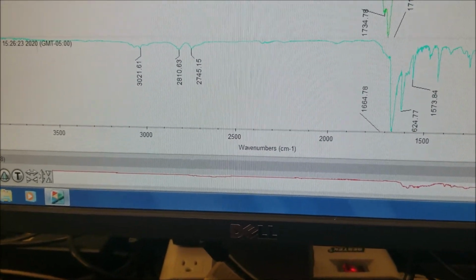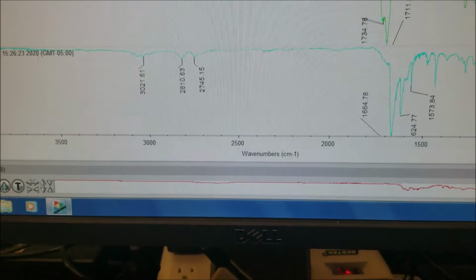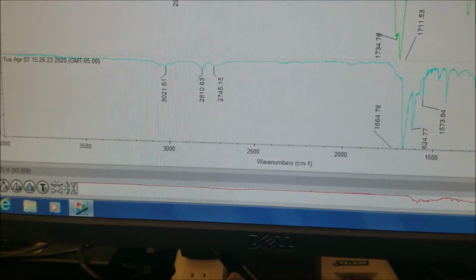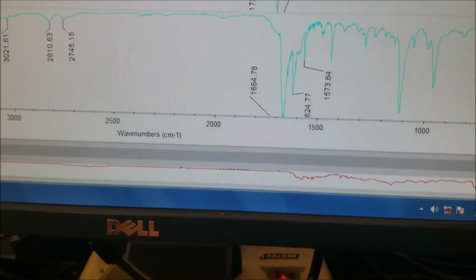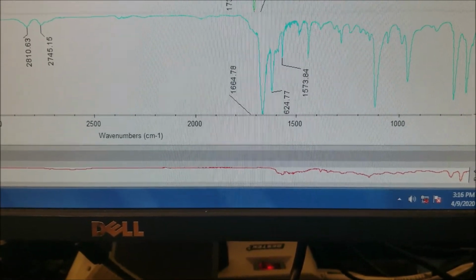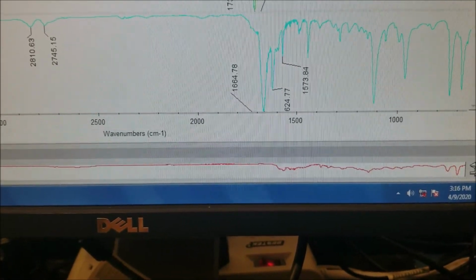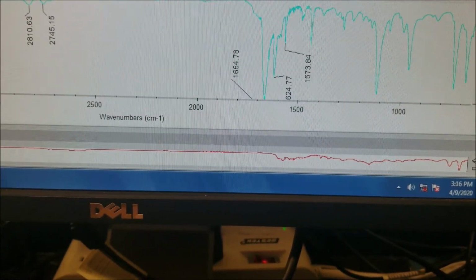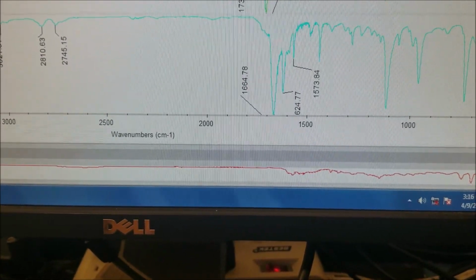And we have the alkene stretches, the sp2 hybridized peaks. We have the peaks at 2810 and 2745. The 2745 you should definitely take note of, as that is most likely our aldehydic CH. Over here we have stretches at 1664, 1624, and 1573. The 1664 is most likely the conjugated aldehyde, 1624 is most likely the alkene, and the 1573 is most likely our phenyl. The phenyls typically don't come nearly as far upfield as the others.